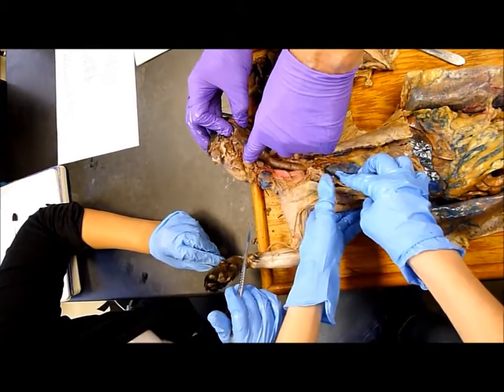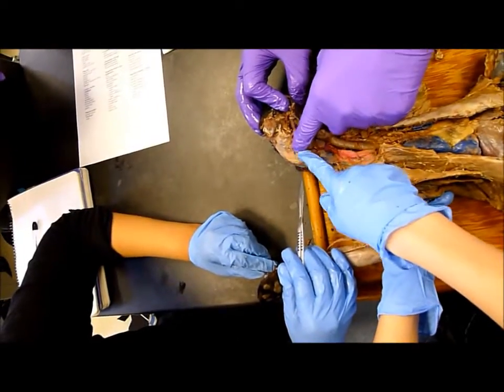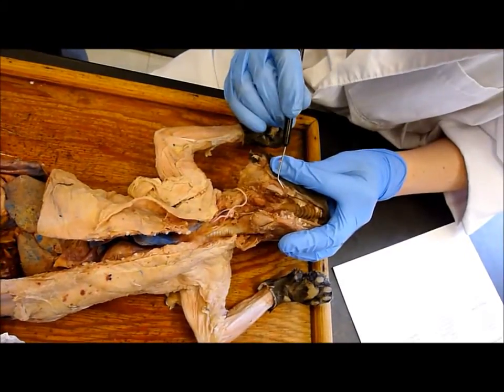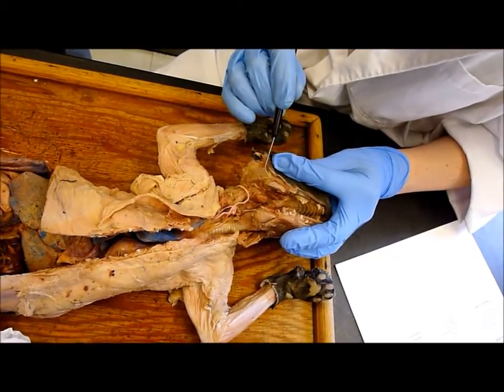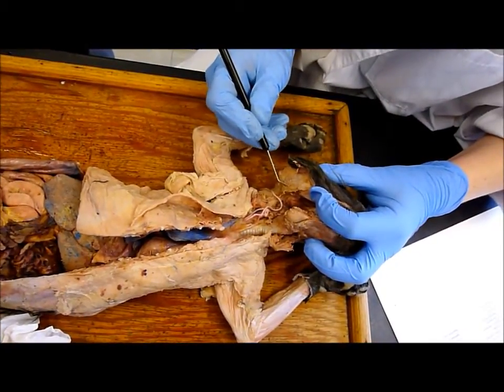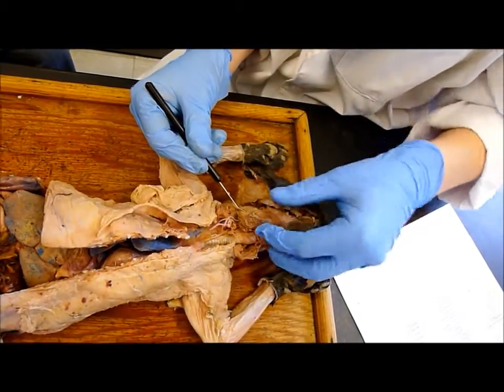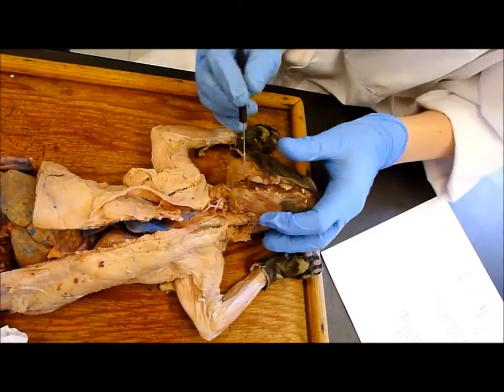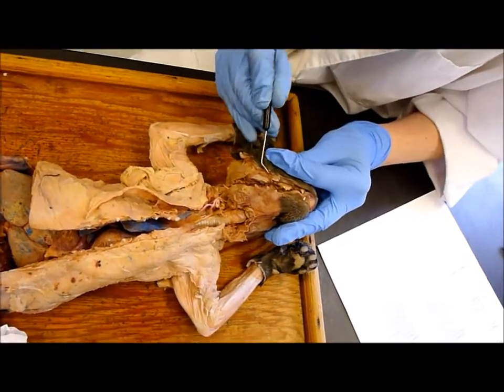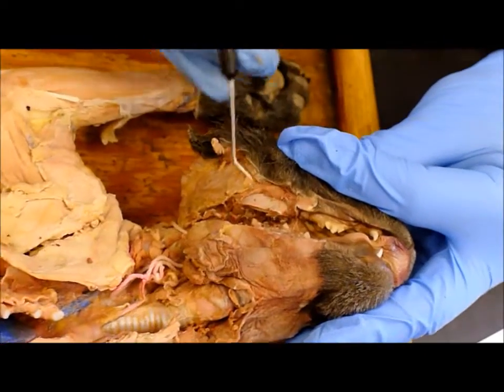You're supposed to know the mandibular gland. The parotid gland is kind of part of it there, but it's kind of chewed. Here you'll see this parotid duct — see the red — it runs to the gland itself. You can kind of see it looks bumpy underneath there; that's the parotid gland. And then that would be the mandibular gland. The parotid duct runs through that fascia, and you can kind of see the end of it right there.